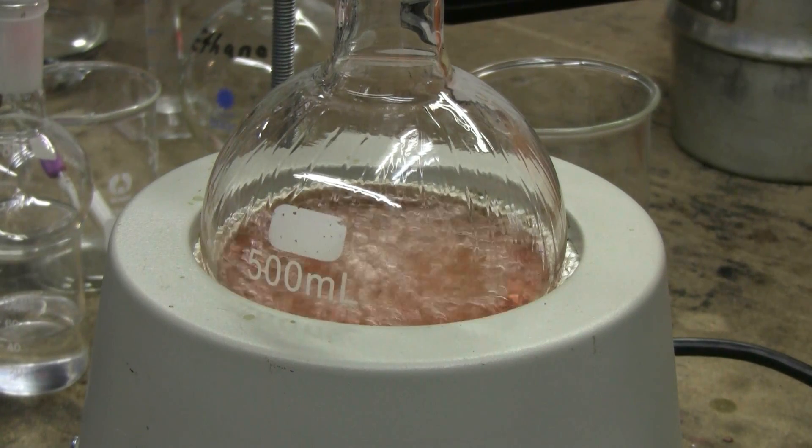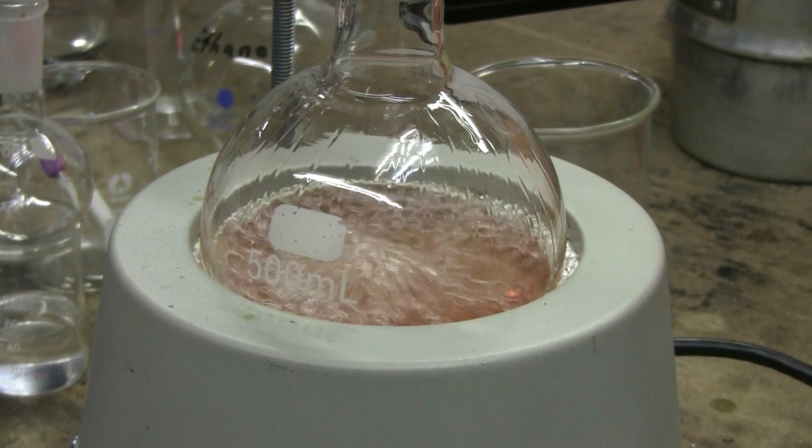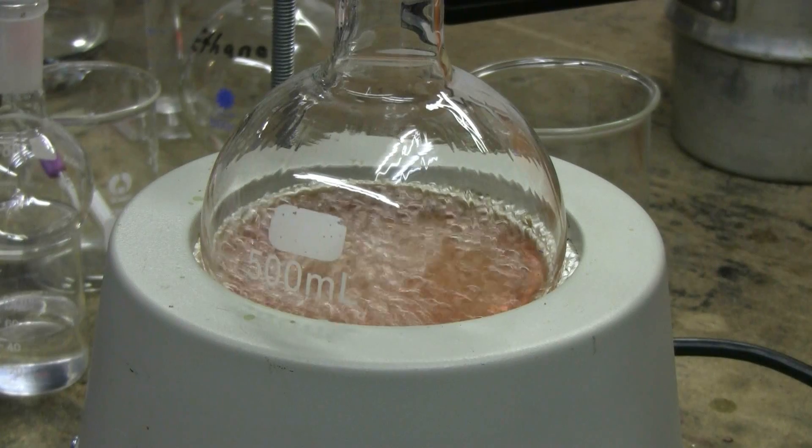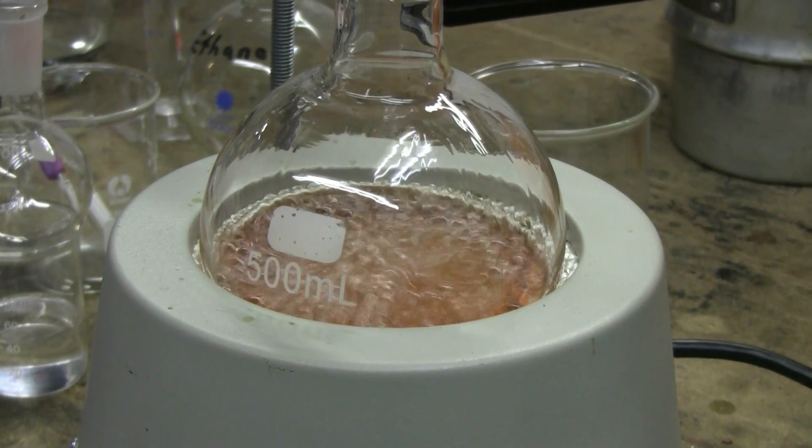We can see the liquid in the boiling flask is turning a nice rosy pink color, representative of the flower petal color.